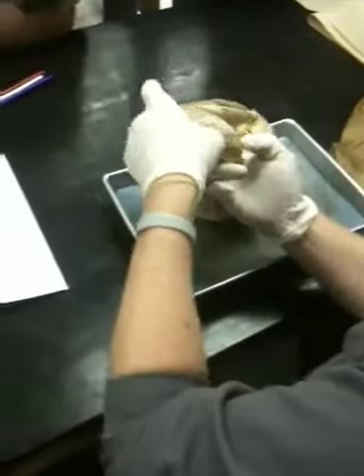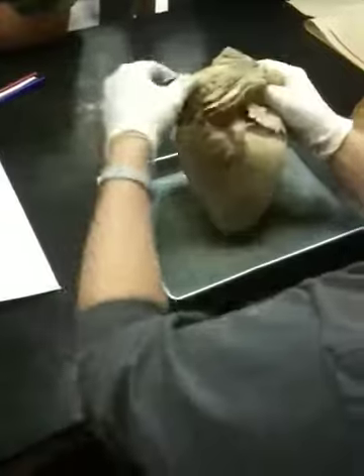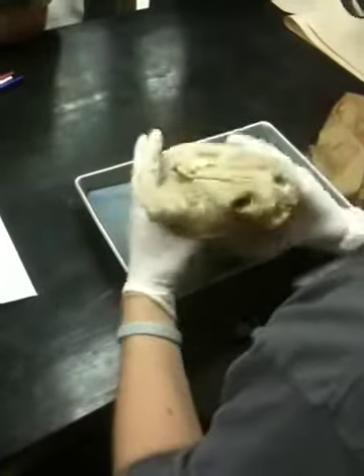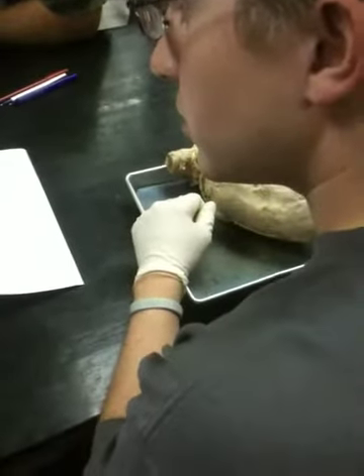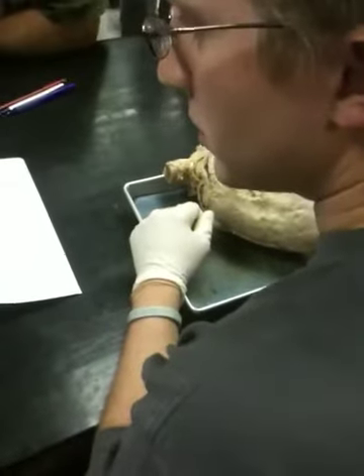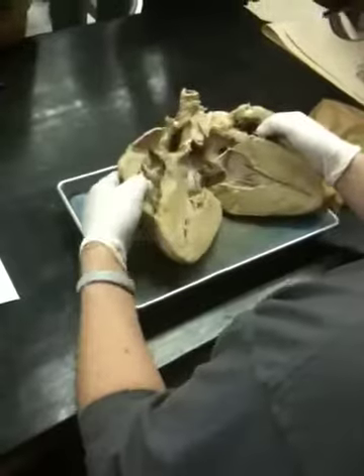These two at the top are both aorta. They meet right here. Brachiocephalic on that side, and then just the aorta on that side. So that is the heart in a nutshell. Capillaries, veins, arteries, capillaries, venules, veins, systole, diastole, valve, diaphragm. Yeah, so that's all the parts you need to identify on the heart.